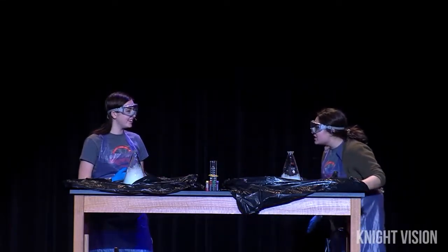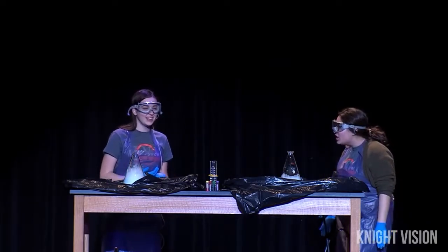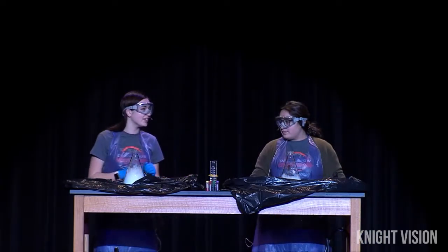Hi, I'm Kayla. And I'm Donciana. And today we're going to be making elephant toothpaste. Elephants can brush their teeth too? No, they're wild animals. Why would they be brushing their teeth? The real reason why this reaction got its name is due to the foam-like reaction that occurs when we put all the ingredients together.